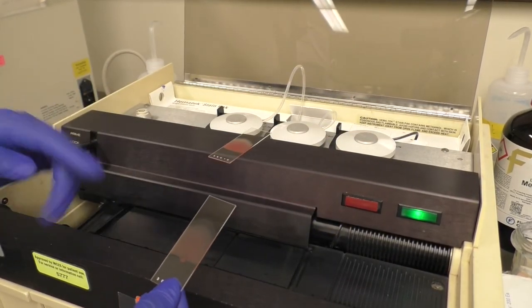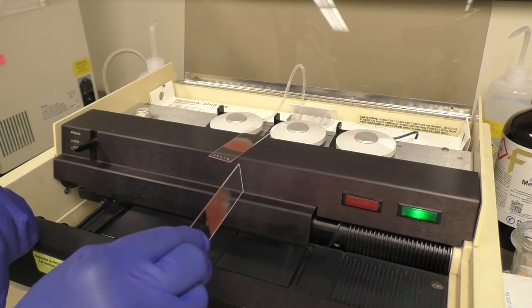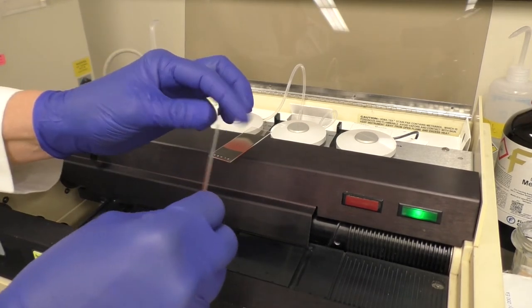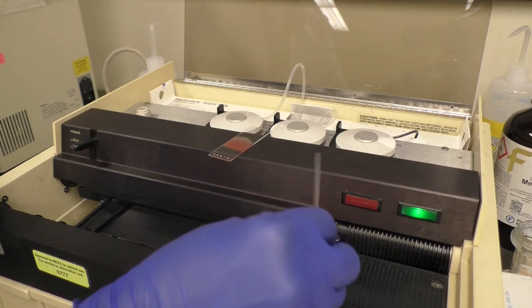The side with the blood film must face to the left of the operator. Place the slide so that the feathered edge of the blood film is toward the back of the instrument.